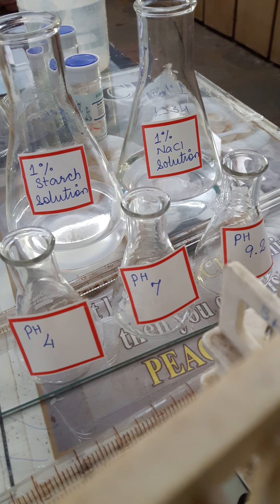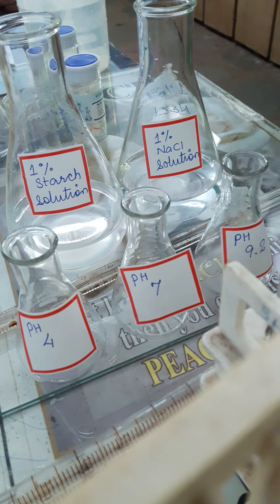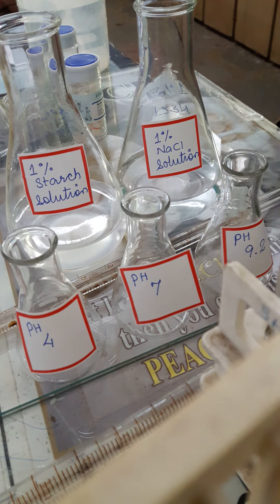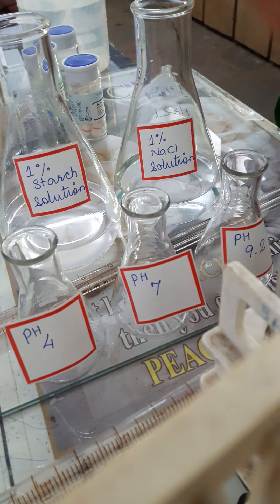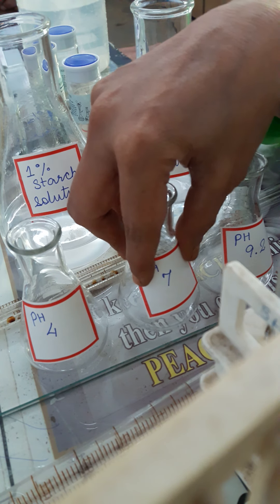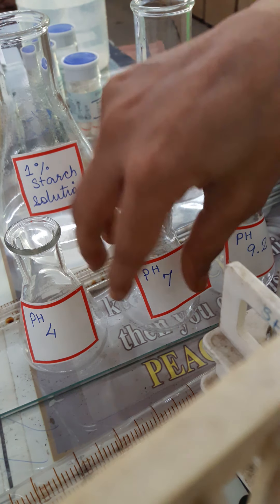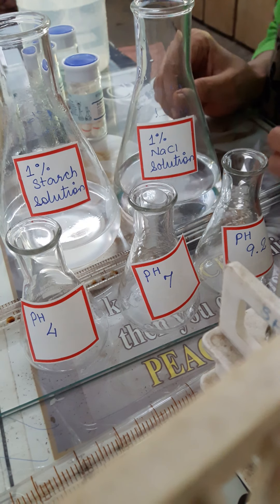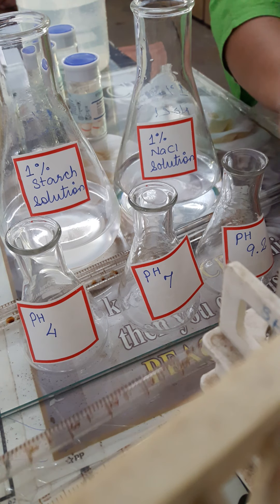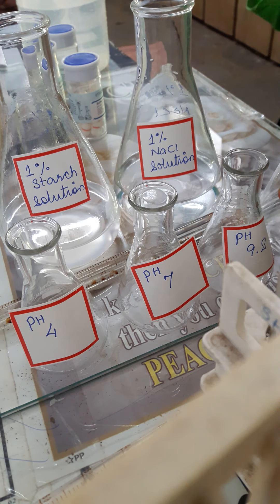Now we are starting the practical on the effect of pH on activity of amylase. You can see that we have prepared 1% starch solution and 1% NaCl solution. We have 3 beakers and 3 flasks labeled pH 4, pH 7, and pH 9.2 — acidic, neutral, and alkaline. Now we will first mix the starch and NaCl in this flask.